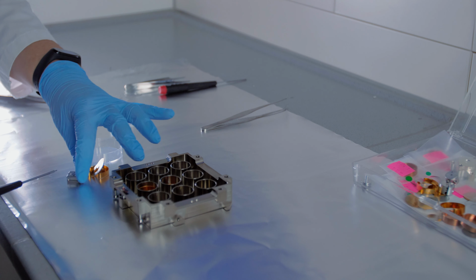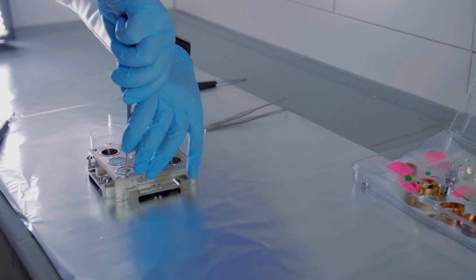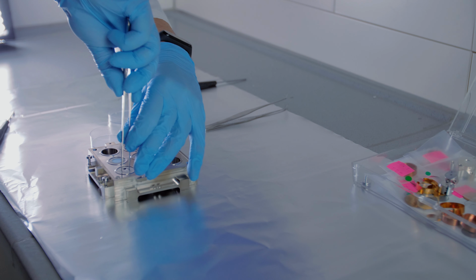The main interest with glass samples is mostly regarding the uniformity and elemental composition of different coatings. Nowadays, most glass products have some kind of coating layer, like anti-reflective or anti-fingerprint coatings on cell phone displays, or even heat-reflecting coatings on window glasses. The dielectric properties of glass create a lot of difficulties in the analysis of these types of samples. However, our instrument is equipped with electron and argon ion flood guns, which give excellent charge reduction capabilities, allowing us to do depth profiling analysis on most samples.